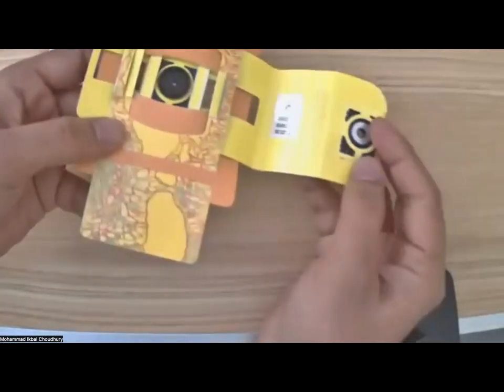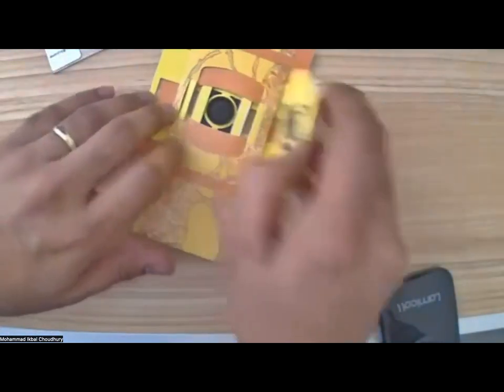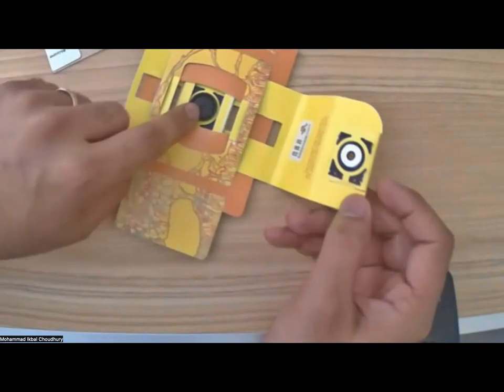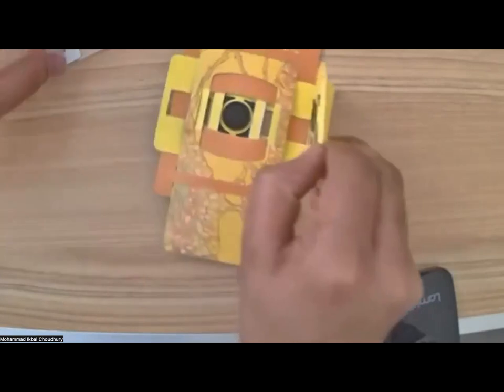All right. So there is our foldscope. You open up this flap here, right? And then you keep it open. It has a tendency to flip back and snap to the magnet. So this thing is magnetic, and the lens is also magnetic. So if you leave it like that, it will snap back to one piece.